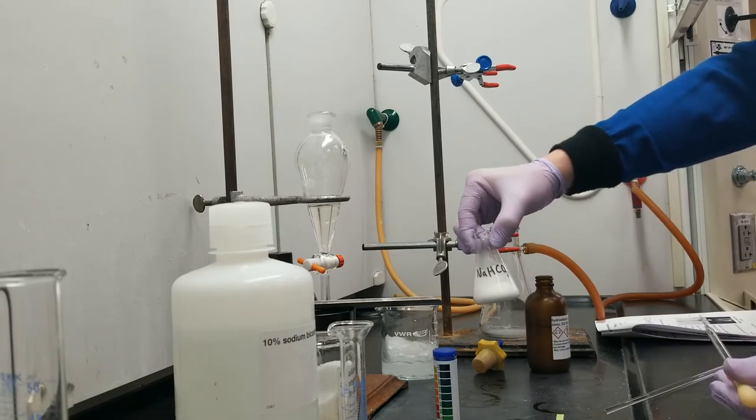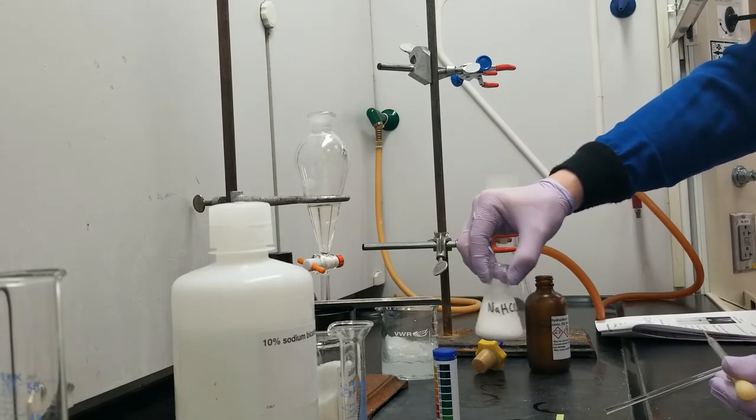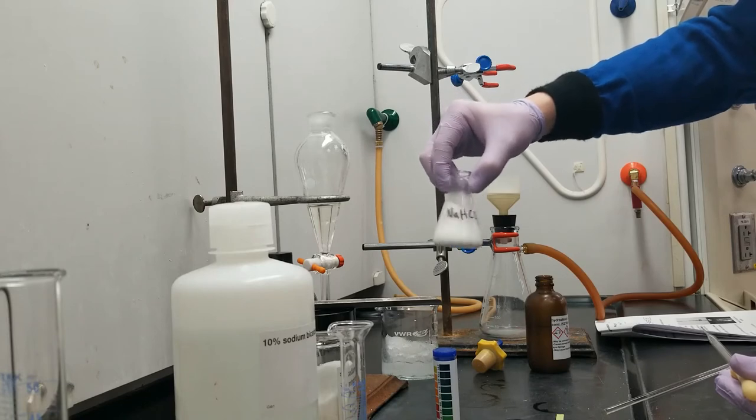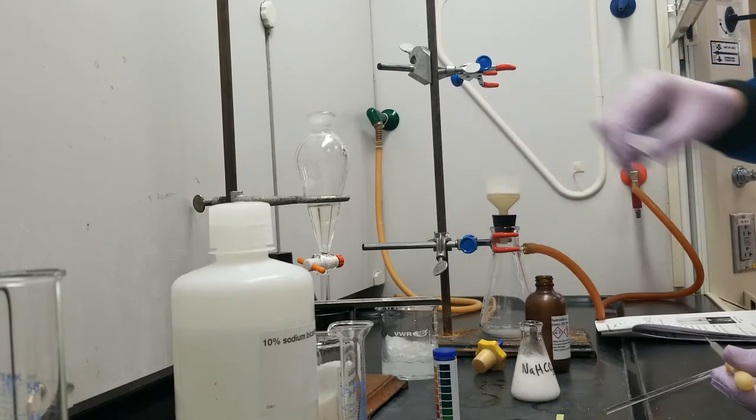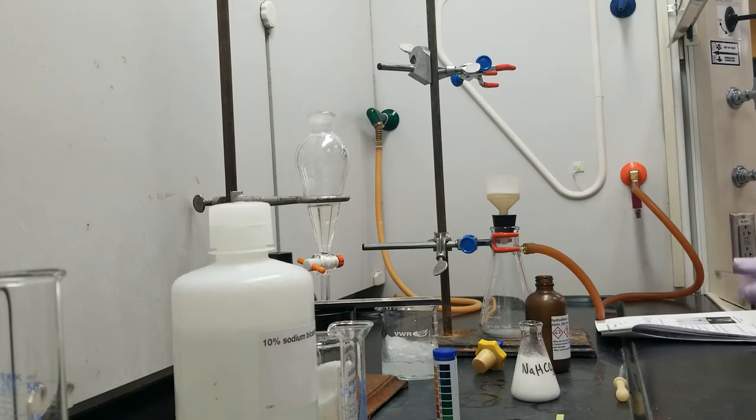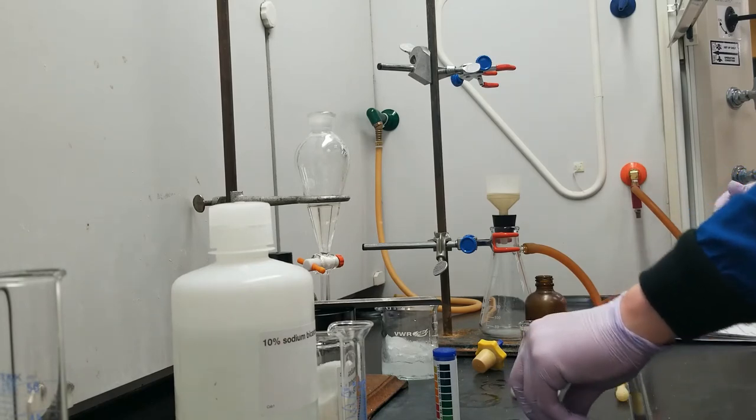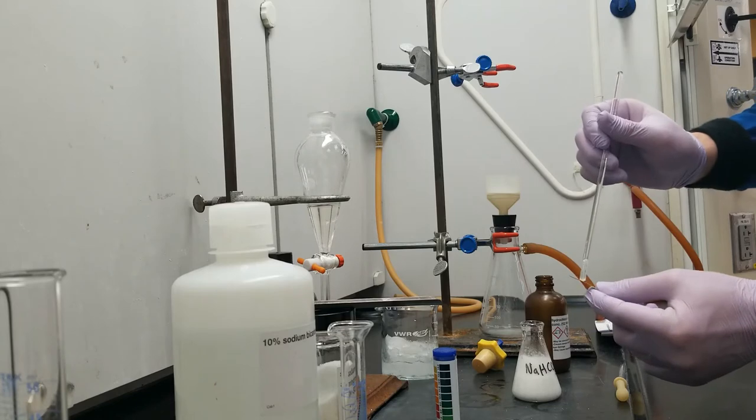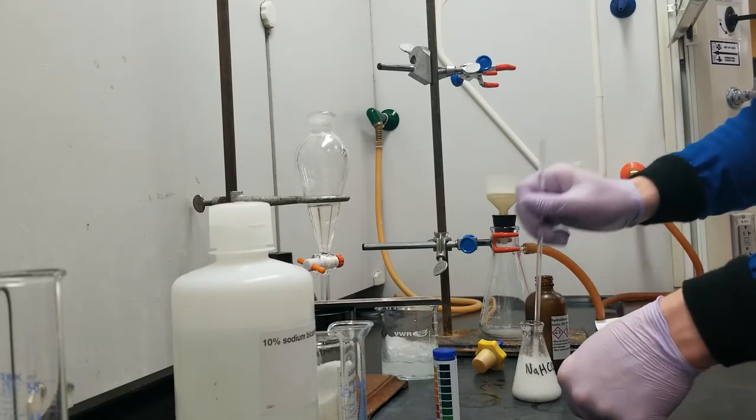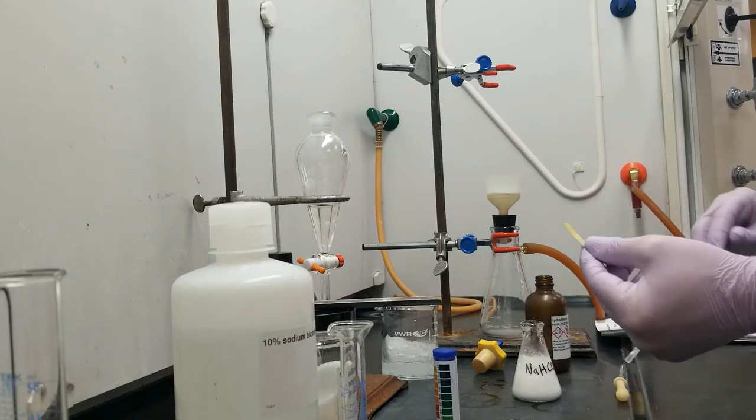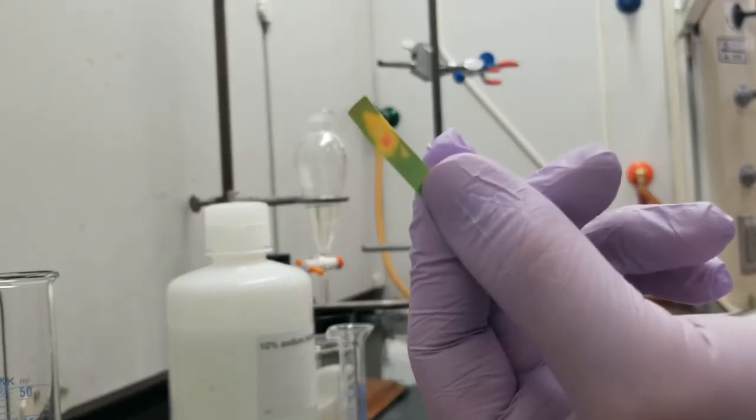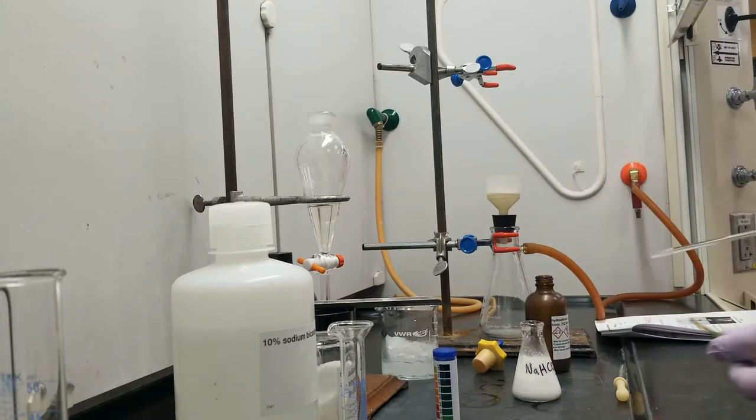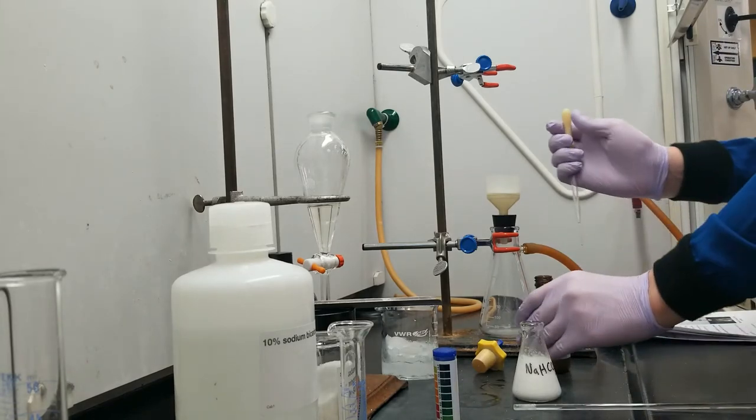I've added another milliliter or so of concentrated hydrochloric acid, and I now have what is approximately a slurpy consistency. It is just packed with solid, it's much more dramatic. So I'm just going to use the other side of the same pH test strip and check this again. I've got a little red spot there, so that's promising. But for the most part, still pretty beige. I've got a little bit more acid to add before I know I've collected everything.